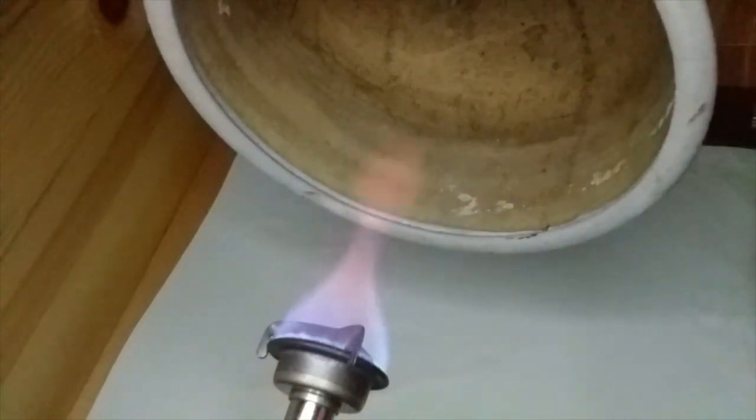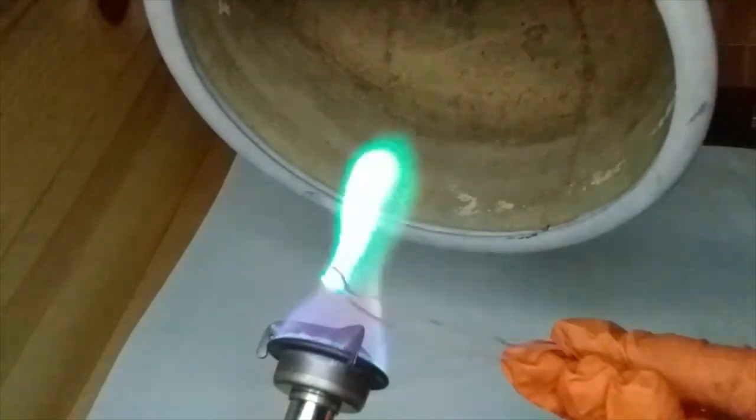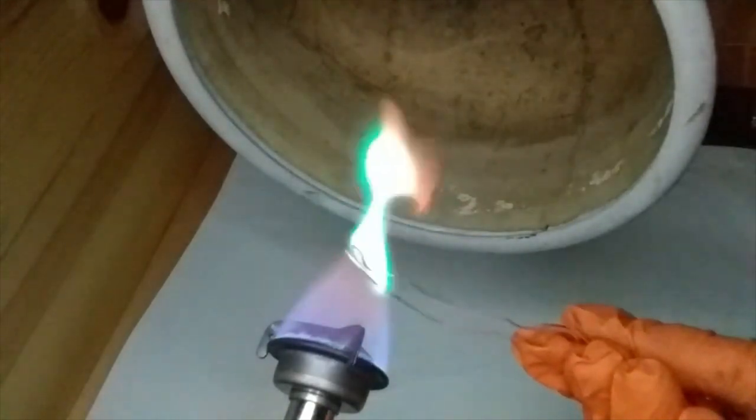So, two pieces of copper wire, or two pieces I guess, there you go, lovely green color.